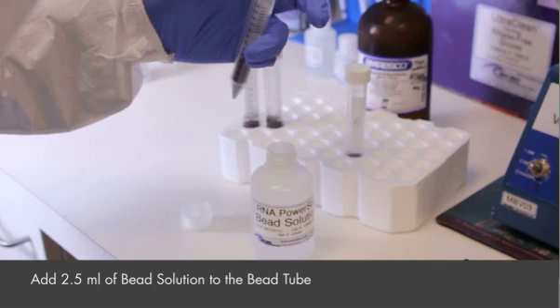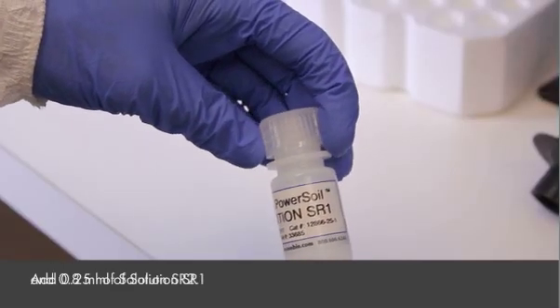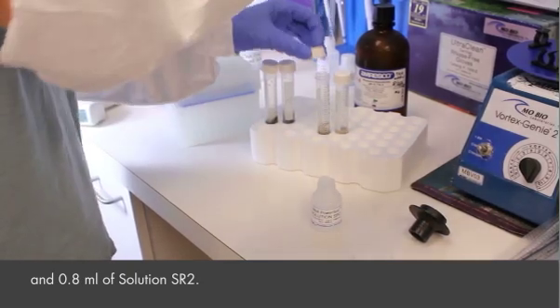Add 2.5 mls of bead solution to the bead tube, followed by 0.25 mls of solution SR1 and 0.8 mls of solution SR2.